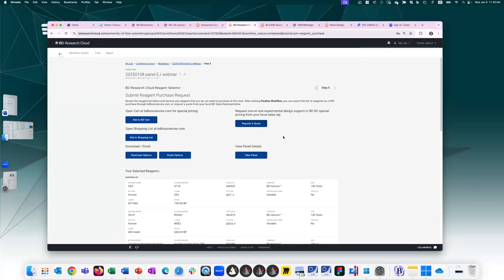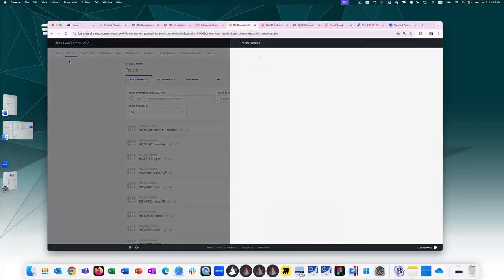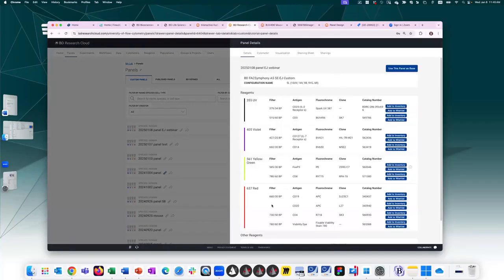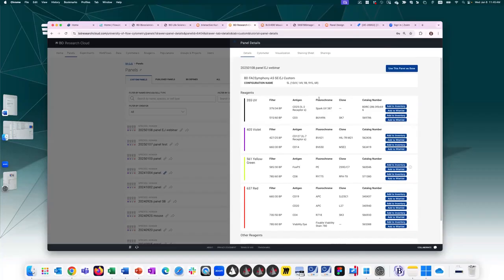It will send a list of all these reagents to your local BD rep who will get back to you with optimal pricing. So if I'm done, I want to see what the panel looks like. If I click on View Panel, it brings me back to that panel section and it opens up panel details. The panel details show me a high-level view of the fluorochrome choices that I've made and the different antigens.